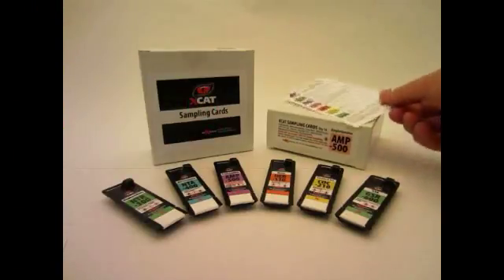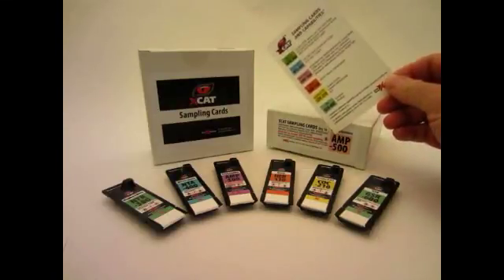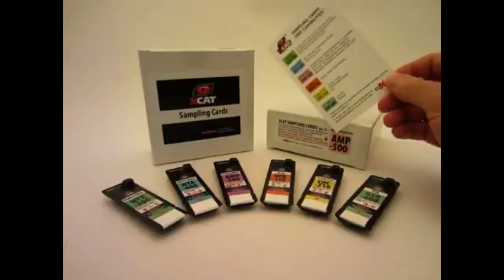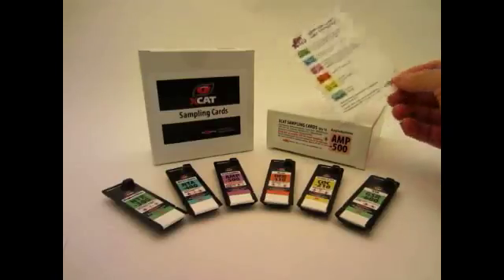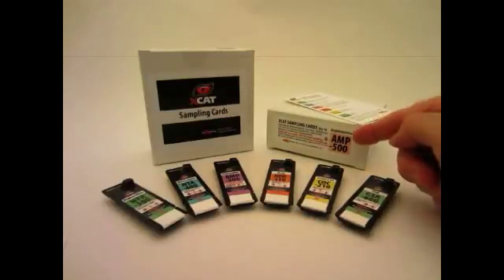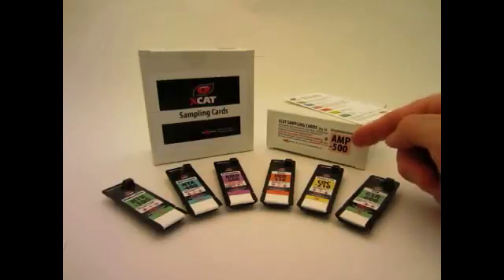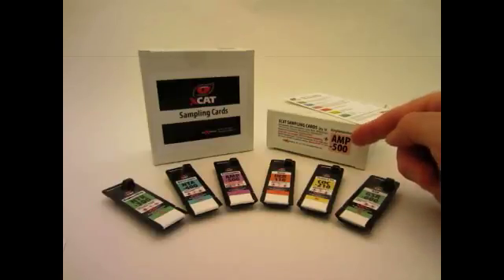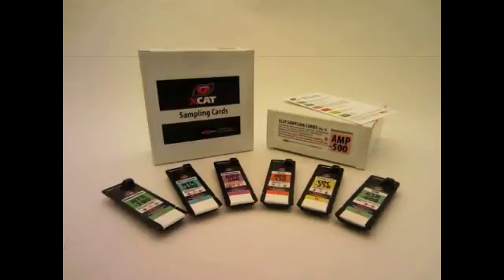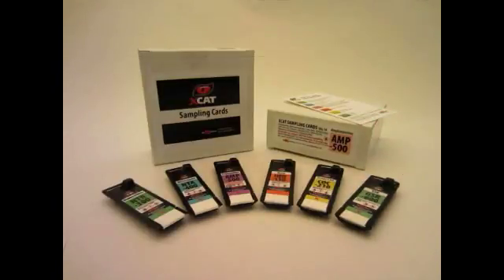Refer to the sampling cards and capabilities reference sheet provided with your XCAT to determine what card to use for the suspected substance. The label on the card box also identifies which analytes the specific card detects. The XCAT can detect trace as well as visible quantities of substances from the sample card.